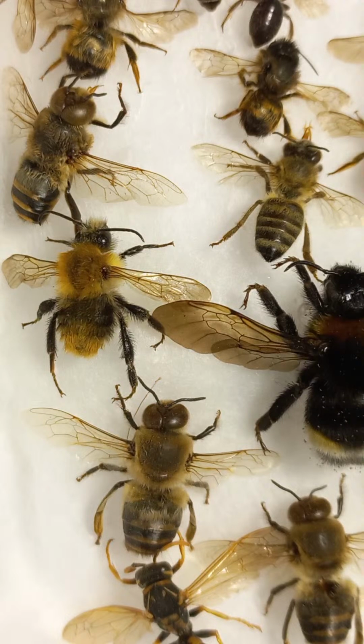Let's talk about the abdomen. The abdomen is the longest part of the honeybee and contains very important organs. But we can talk about anatomical structures later. We talk now about external structures. The abdomen is armor-plated with scale-like segments called tergites, or top segments, and sternites, or bottom segments, that protect the honeybee and keep it from drying out.